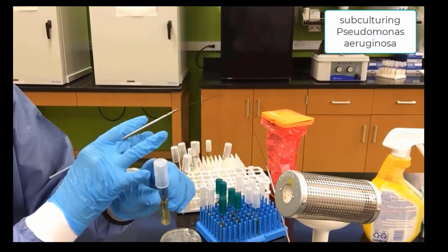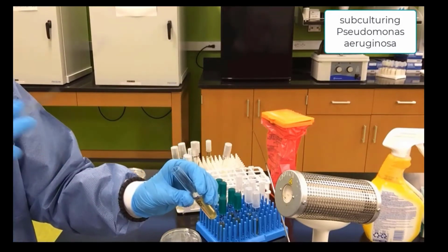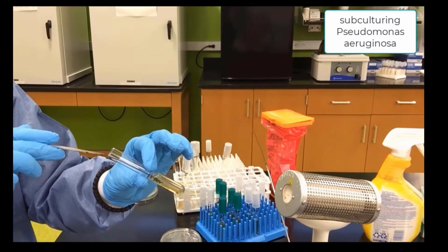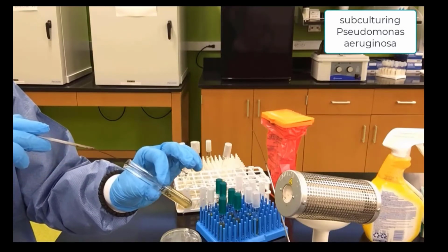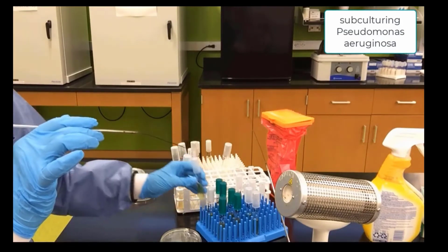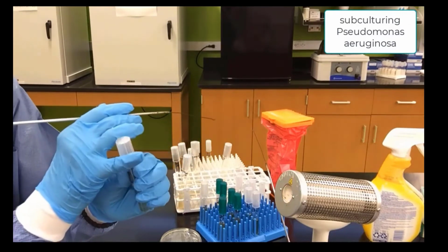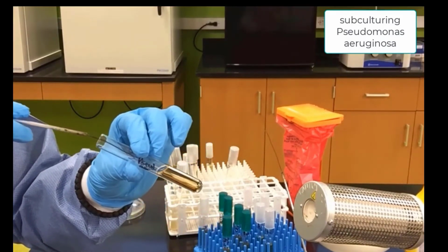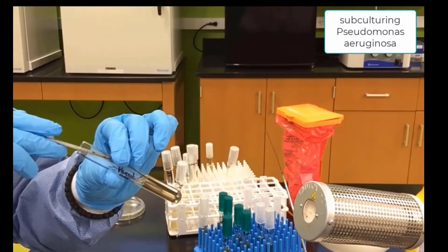We pick up our Pseudomonas aeruginosa, use our ring finger and our little finger to pull off the white cap, go in with the loop into the actual original Pseudomonas aeruginosa, best to go to the bottom to collect a good sample. And now we will transfer this Pseudomonas sample or subculture it using the aseptic, no contamination technique, into a new sterile liquid. We go in and we swirl around the new Pseudomonas culture.